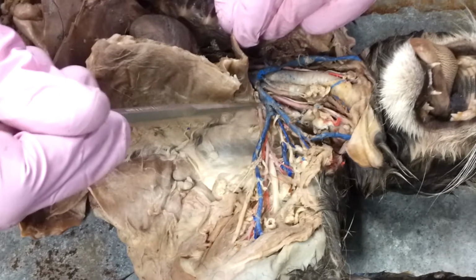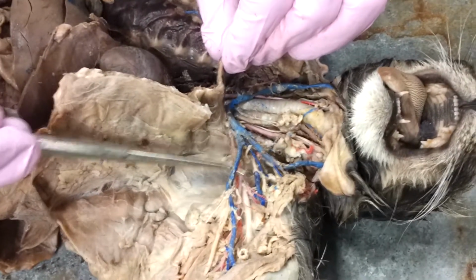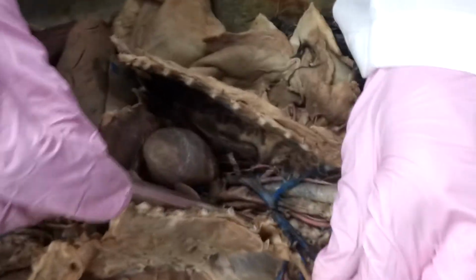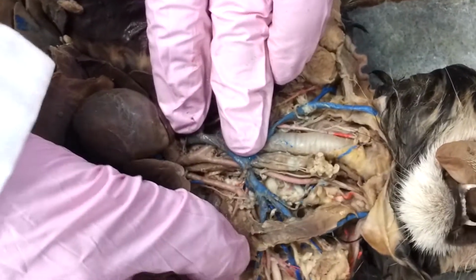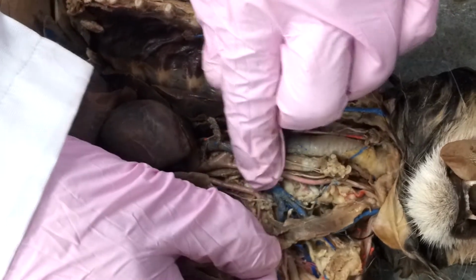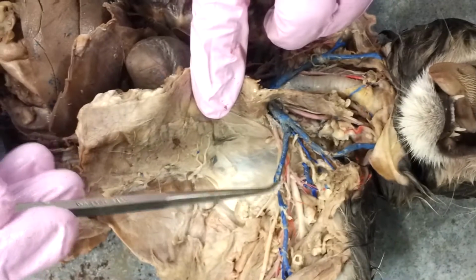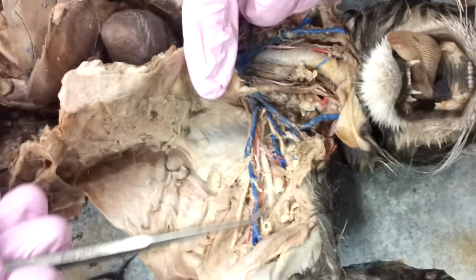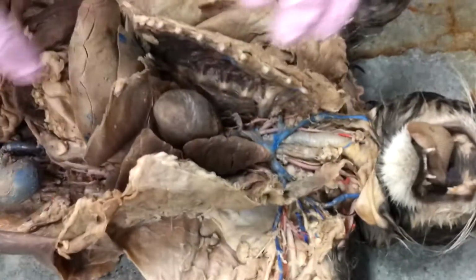So we've got our brachiocephalic, and here's our external jugular, and then we've got our subclavian right on the inside, and depending on how far you push up, you can see the subclavian vein. We only have a little bit of a subclavian vein here, and then it picks up again, and we've got our axillary vein here, and then our brachial in our arm. So the veins are a little easier.